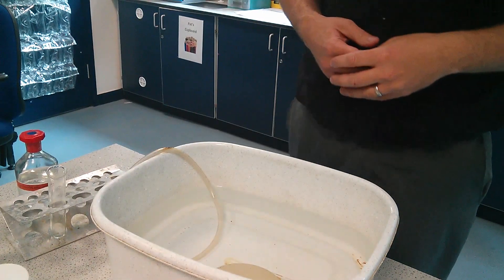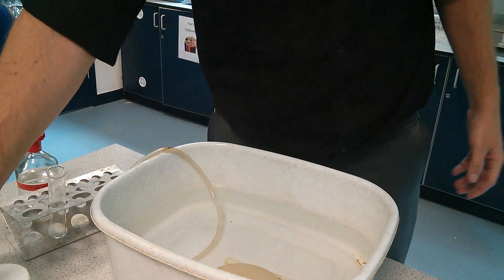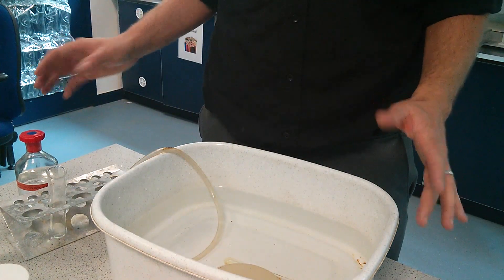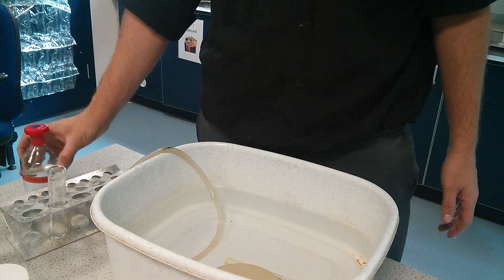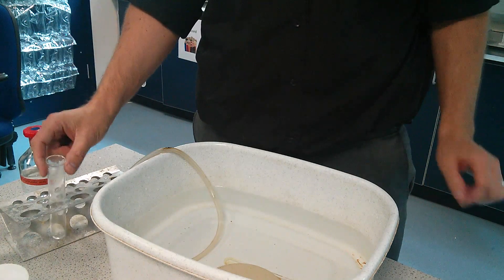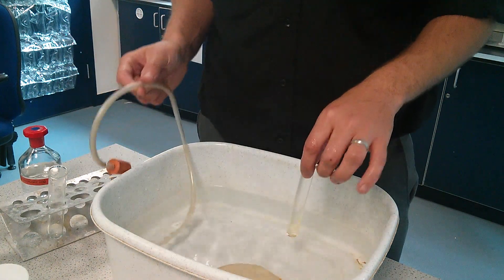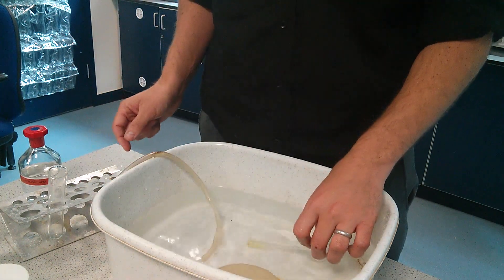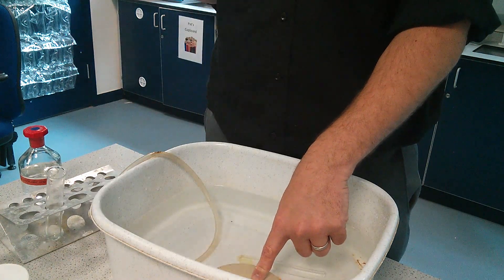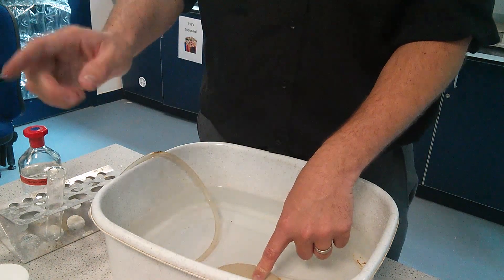Today we're going to find out the effect of surface area on the rate of reaction. Here is the equipment that we need: molar hydrochloric acid, a test tube rack, a boiling tube, a test tube, a delivery tube, a beehive shelf, a stopwatch, and around the room there'll be some scales.